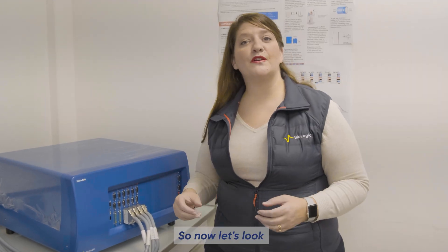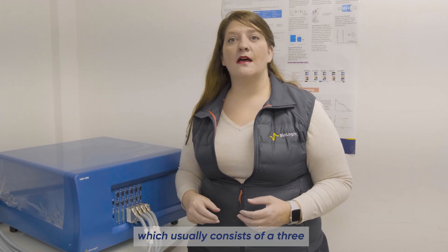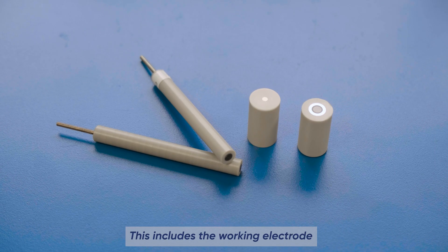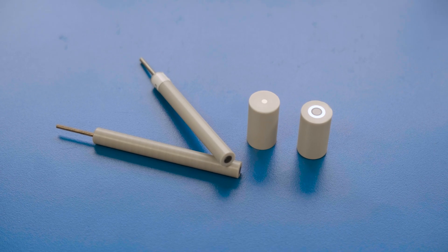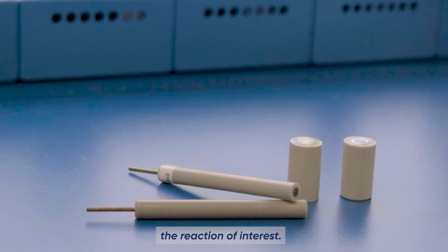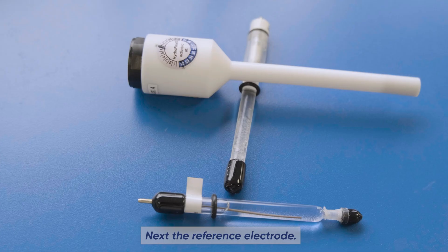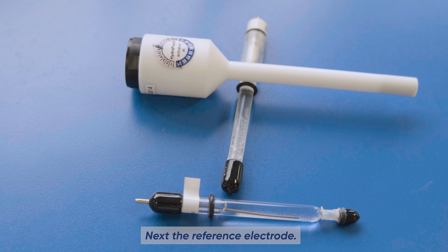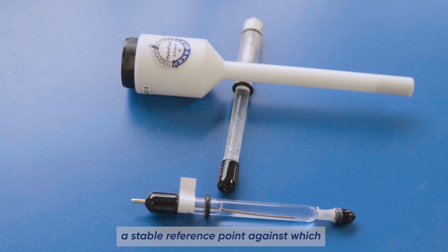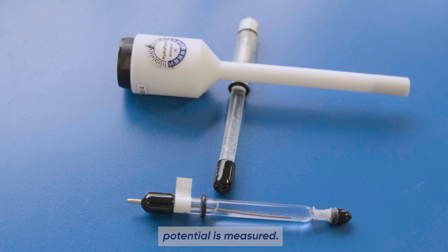Now let's look at an electrochemical cell, which usually consists of a three-electrode system. This includes the working electrode, which looks something like these, and this is where we study the reaction of interest. Next, the reference electrode, which provides a stable reference point against which the working electrode's potential is measured.